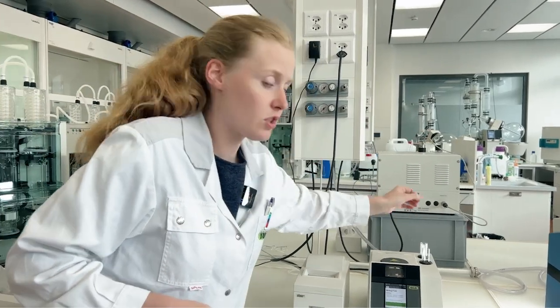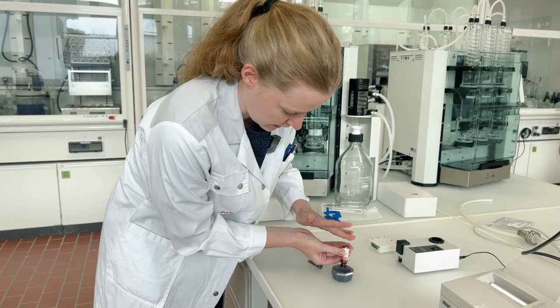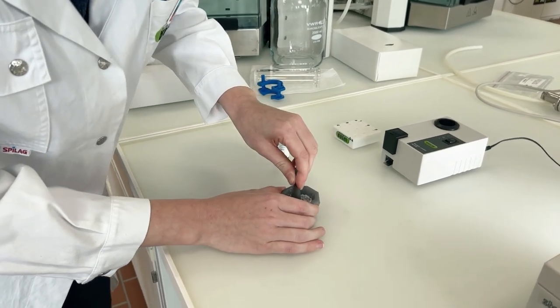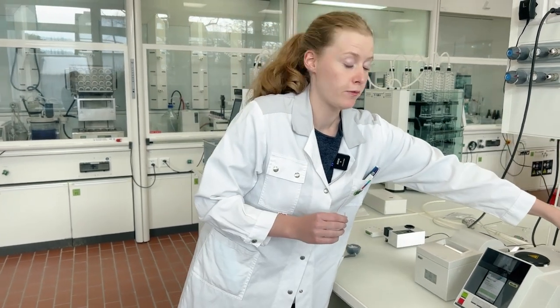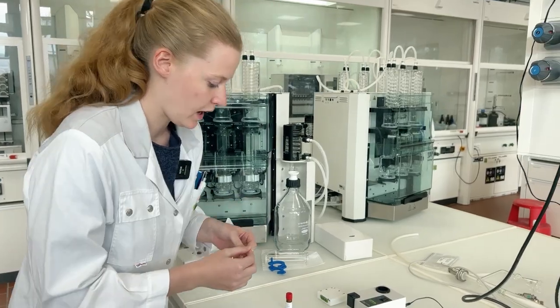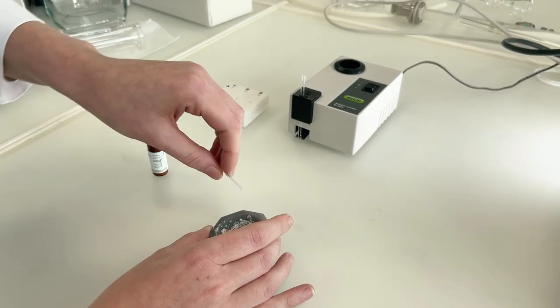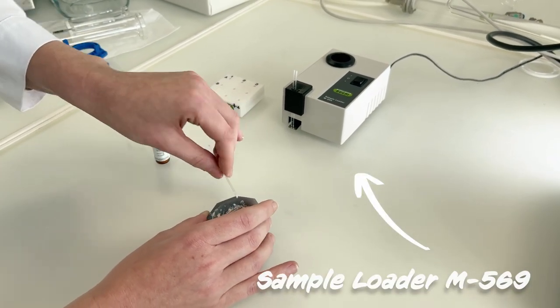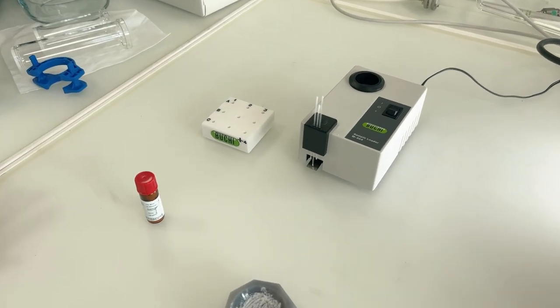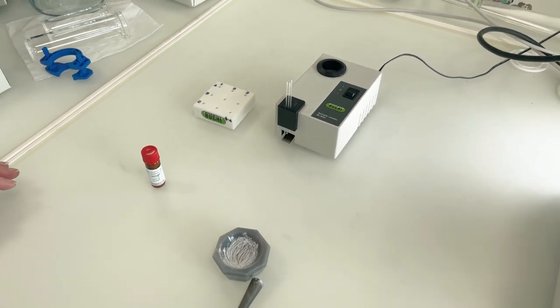To start sample preparation, we first need to grind the sample for five minutes to ensure consistent quality. Now that we've ground the sample, we fill the capillaries. For one melting point measurement we always need three capillaries, so I'll fill all three using our sample loader. The sample loader also ensures consistent sample quality by compressing the sample just right — not too much and not too little.